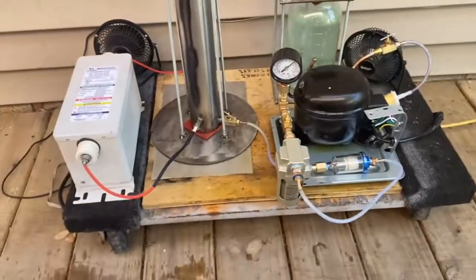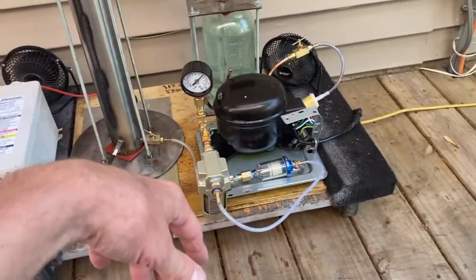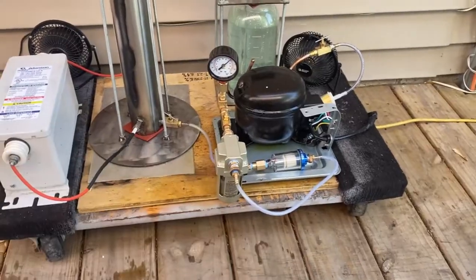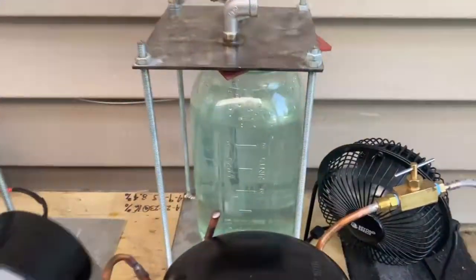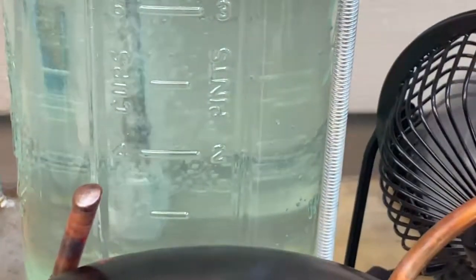My pump failed on me, so I had to build a new pump and it was kind of a challenge. Things didn't work out in the beginning, but I've got everything flowing good again. I actually might turn that up just a bit.